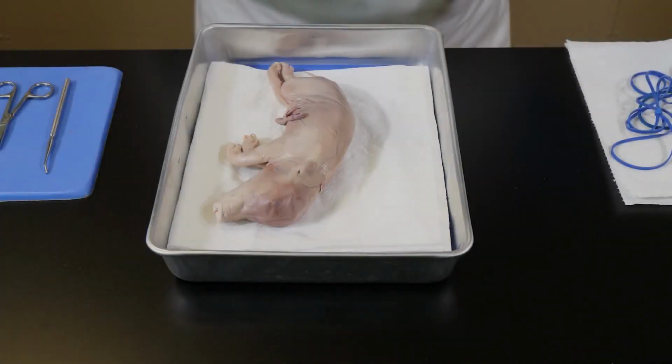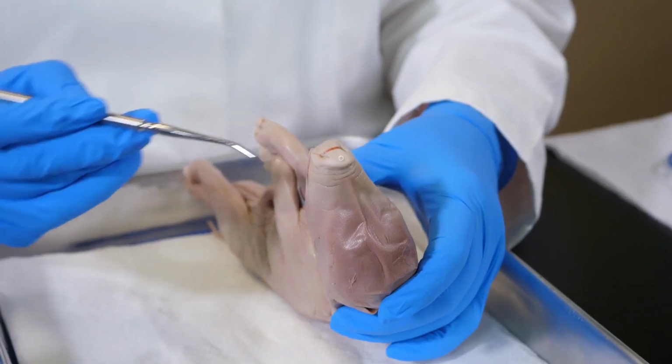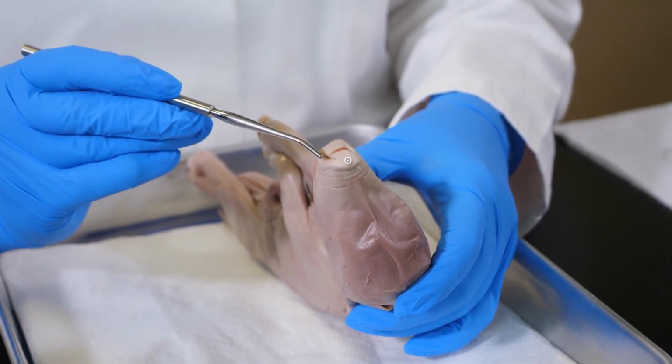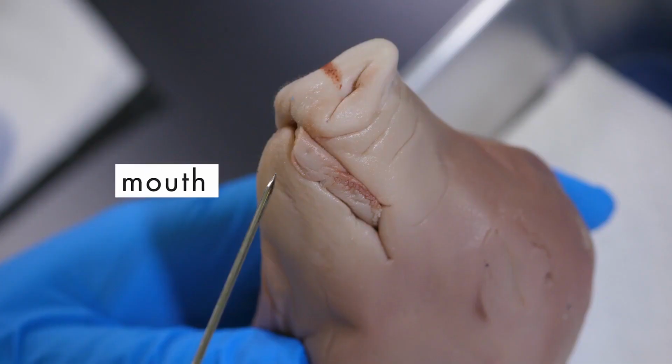In this lab, we will examine the external anatomy of the pig and then perform a dissection to explore its digestive and excretory systems. One of the distinguishing features of a mammal is hair. However, at this stage in its development, the fetal pig has only a few hairs. One of the most distinctive features of a pig is its flat snout, located at the anterior end. Two nostrils, used for breathing and smelling, are located in the snout. Below the snout is its mouth.